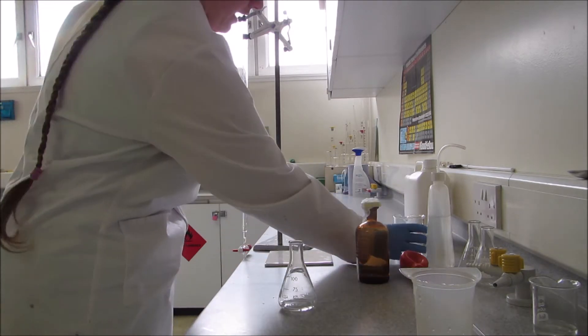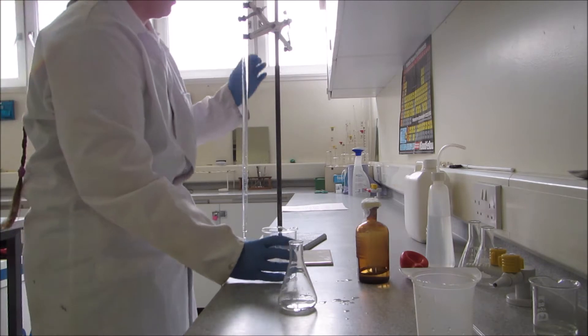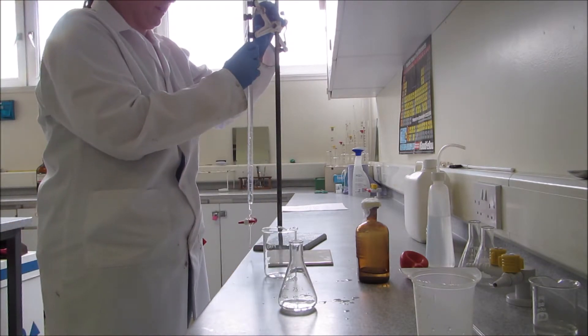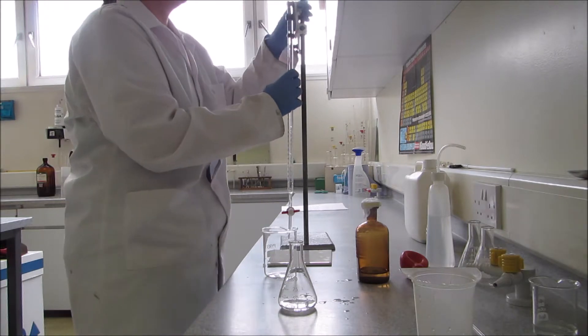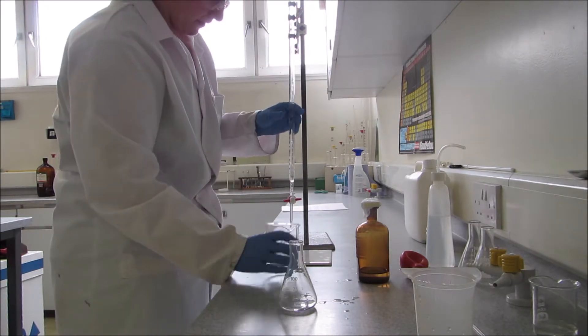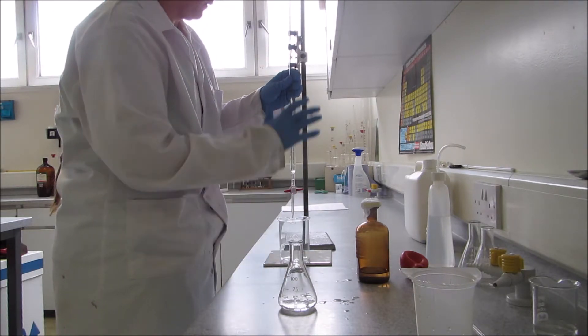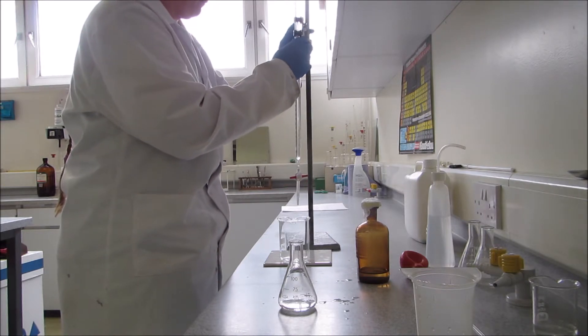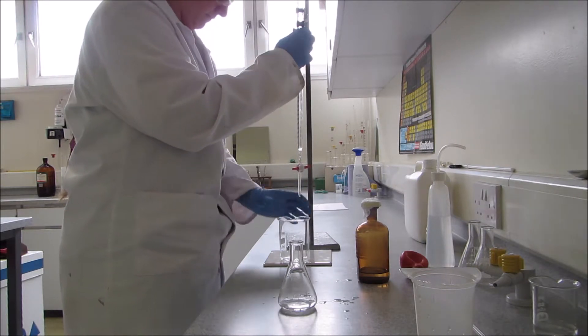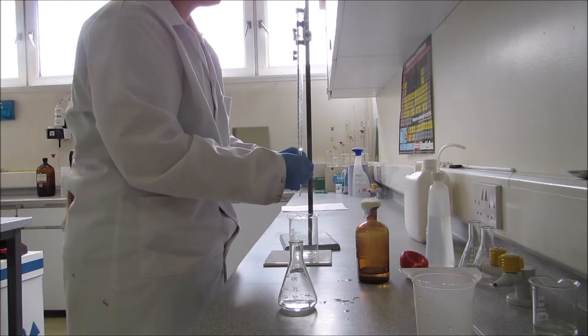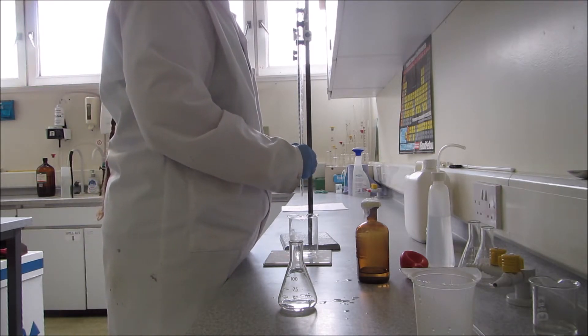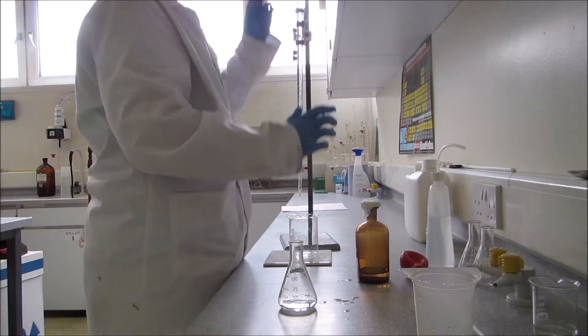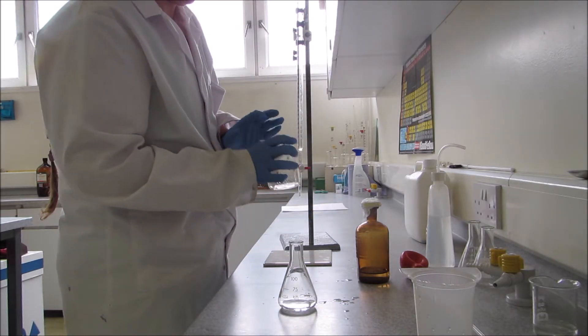Close it over. And then I've got a beaker for the silver nitrate waste. I'll just put my funnel into my beaker.